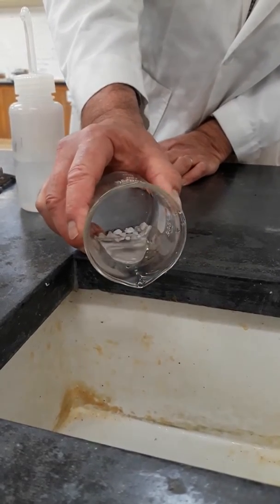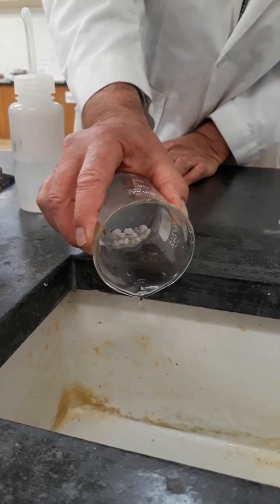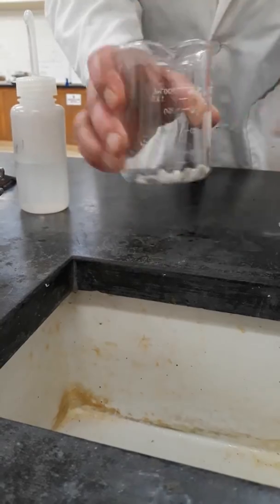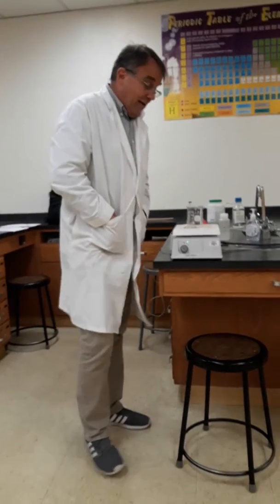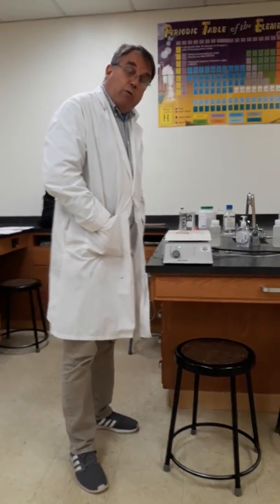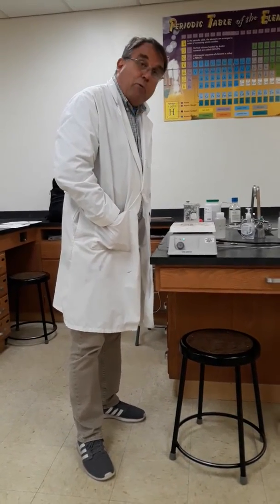And then we want to dry the marble residue back on the hot plate. Which is another point where we can pause it. You can work on the post-lab questions, or through the magic of video we will just pause it, because if there's anything more boring than watching marble dissolve, it's watching water evaporate.